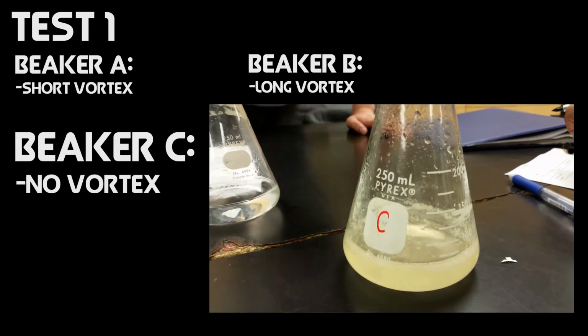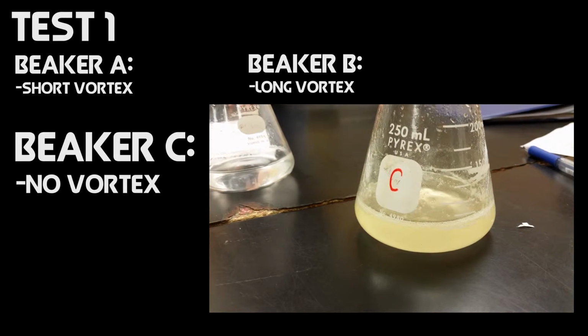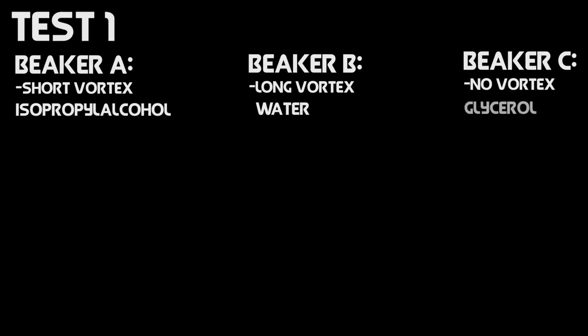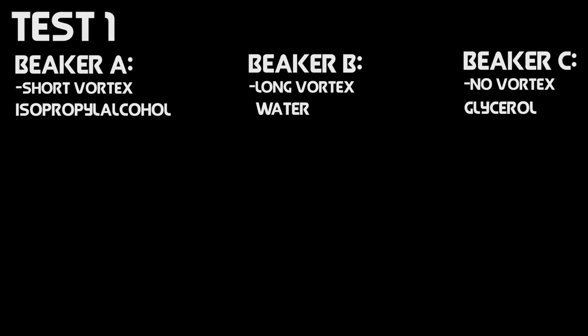For beaker C, the solution was incapable of producing a vortex. The substance seemed to be very viscous. From these results, I was able to conclude that beaker A contained isopropyl alcohol, beaker B contained water, and beaker C contained glycerol. So when a vortex is formed, it's kind of like a tornado, which is being sucked into the bottom of the glass beaker.